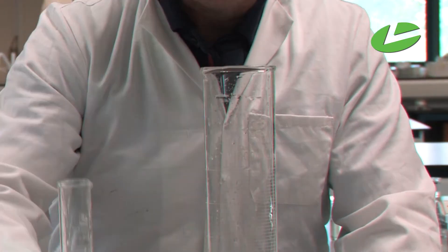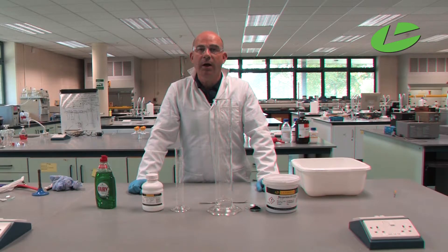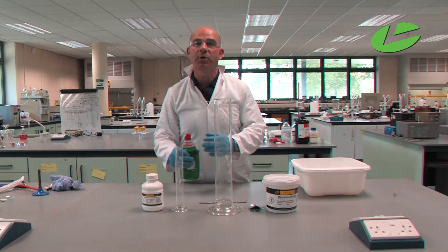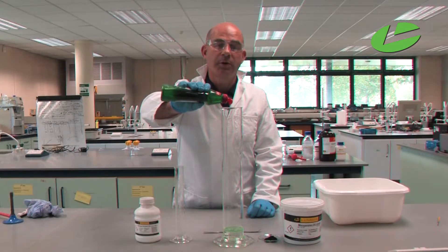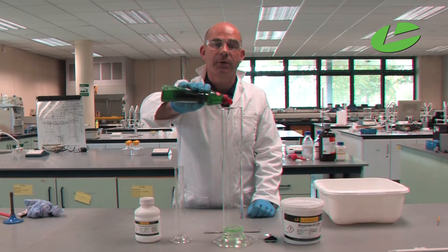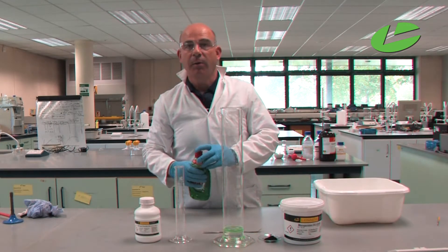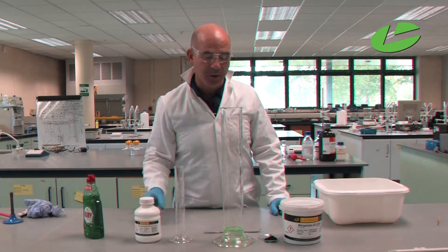When hydrogen peroxide decomposes it liberates oxygen gas. To catch that oxygen gas I'm going to put in some washing up liquid. What the washing up liquid does is that any bubbles of gas that are formed will go into the washing up liquid, and we can see how much oxygen is being produced.